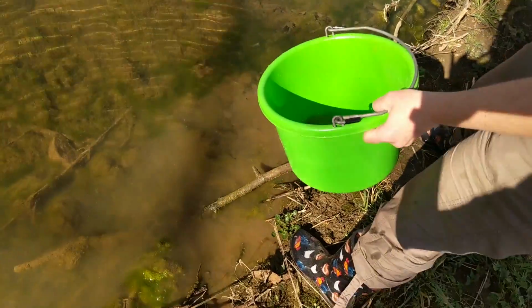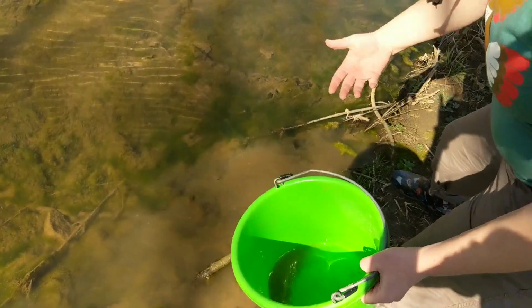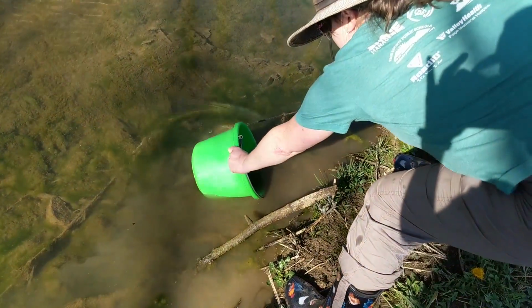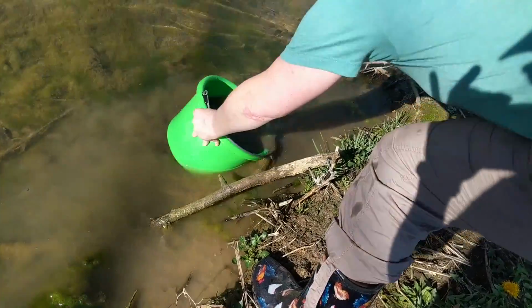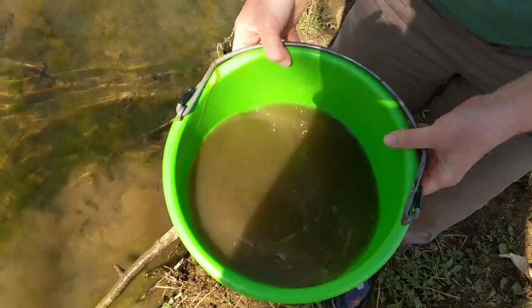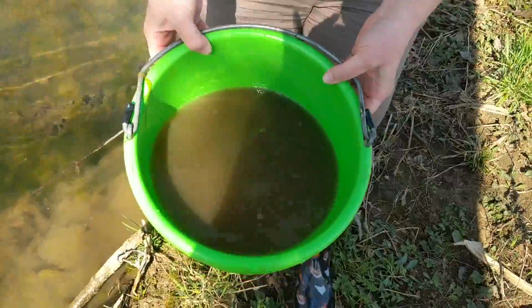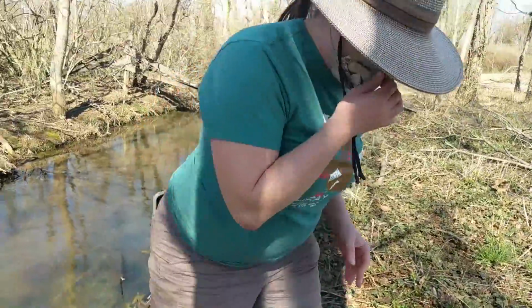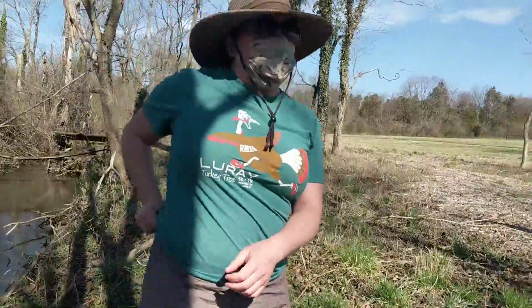We want to show what it looks like when we stir up some of the sediment. Turbidity is the amount of sediment in water. So I have stirred up a little bit on the edge of the bank here. Take a look at that. Ew. Yeah, got lots of bits of particles and sediment in this water. So now we're going to see what that looks like as far as our reading.